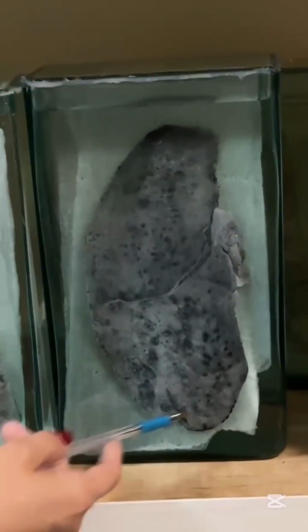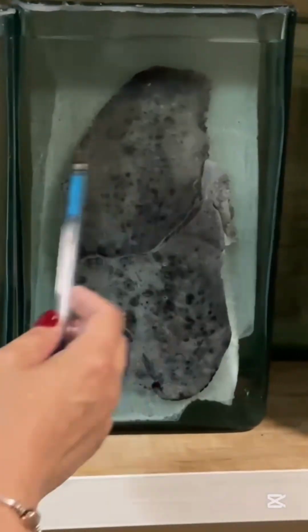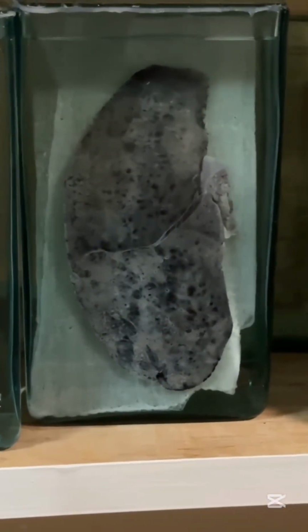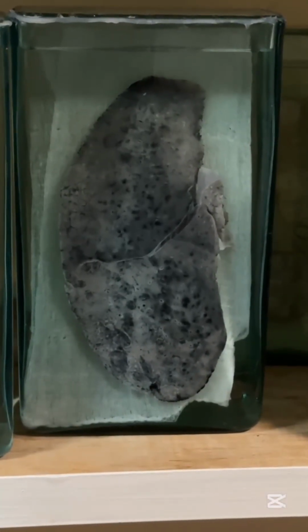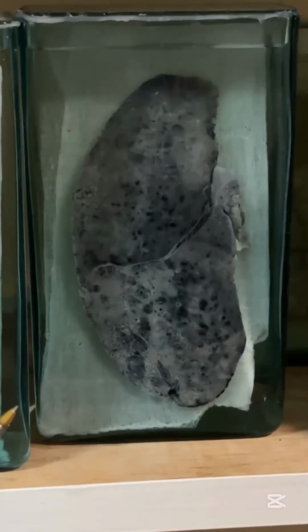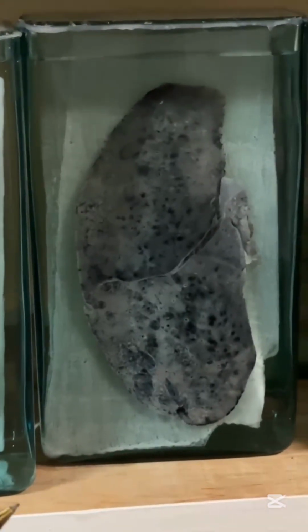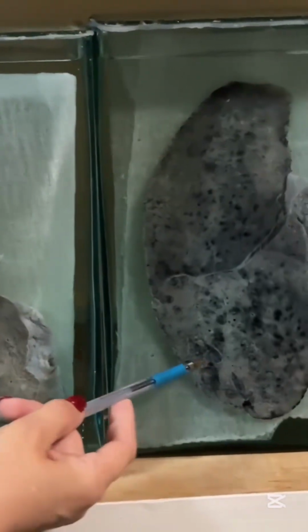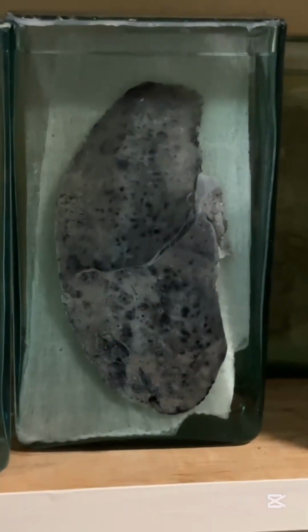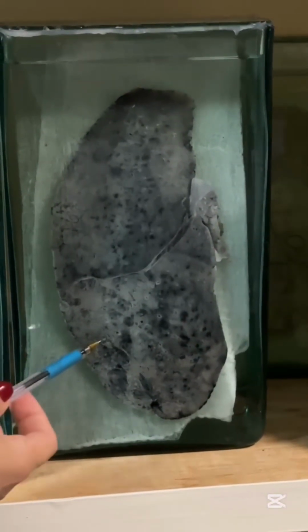You see, lung. That is lobar croupous pneumonia, consolidation of the whole lobe. It is the stage of gray hepatization because of accumulation of fibrin and neutrophils. Lung tissue is airless because of fibrin and resembles the consistency of liver. But this lobar pneumonia has a complication, you see cavities, lung abscesses. Pus is absent because of fixation, only cavities you can see.